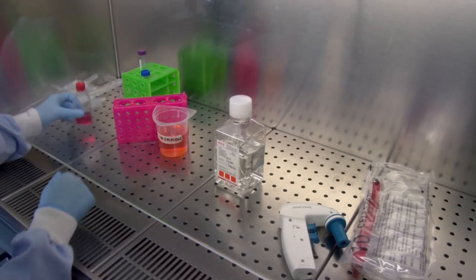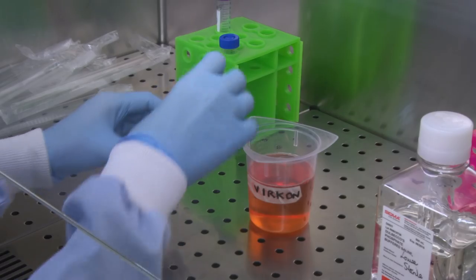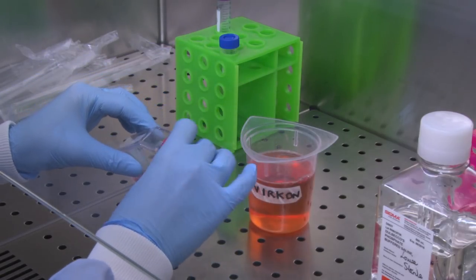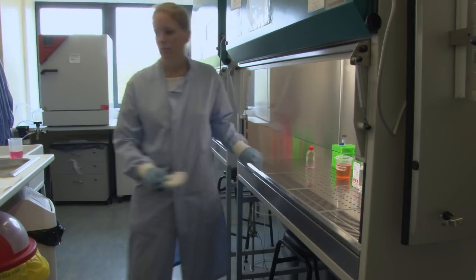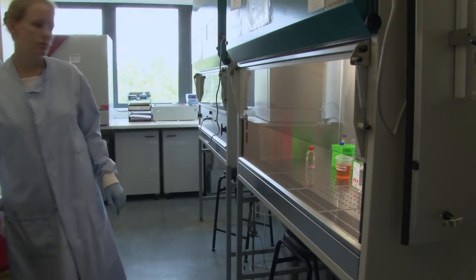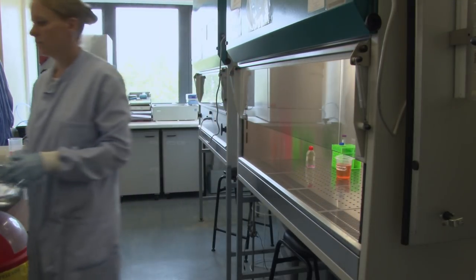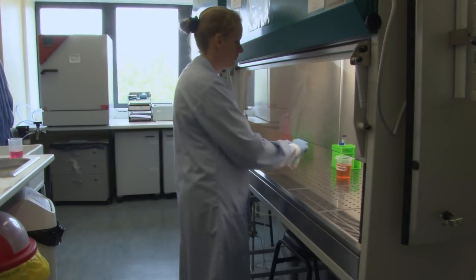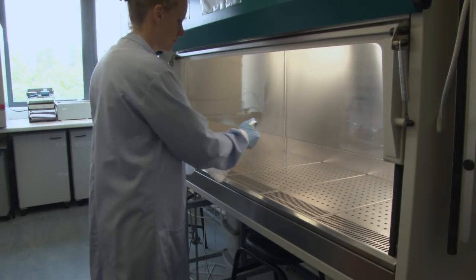The last step is to clean up. All liquids go into the disinfectant for at least two hours prior to disposal. The trypsin and fresh culture medium are replaced in the fridge. All inside surfaces of the cabinets are cleaned and ready for the next user.